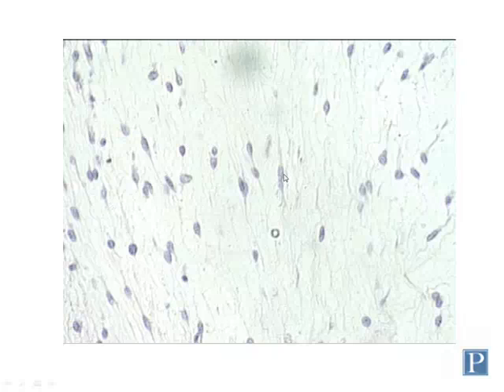The cells are not packed very densely together. They have a very regular oval-shaped appearance. They're slightly elongated, and the cells have lots of fibrous extensions or cytoplasmic extensions. There are no extracellular fibers in the extracellular matrix in this tissue, so these long processes you're seeing here are not fibers, rather they are cytoplasmic extensions of the cells themselves.